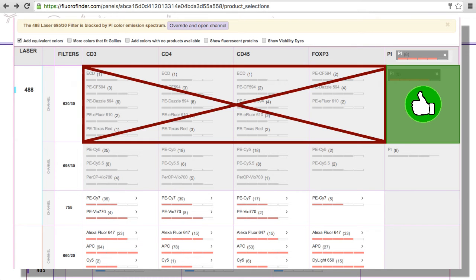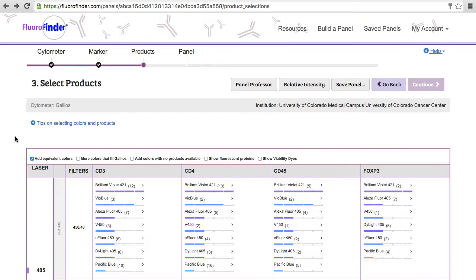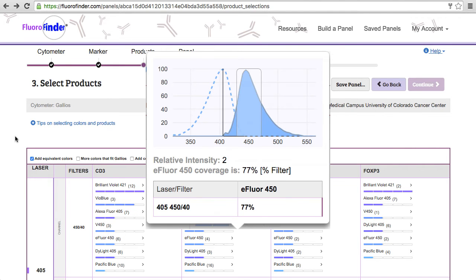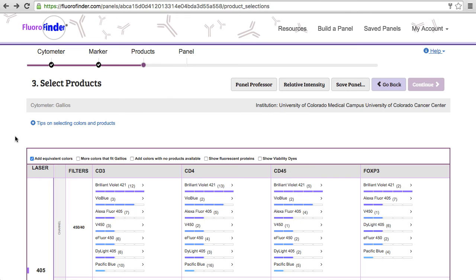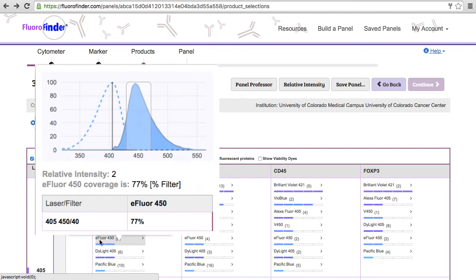It prevents selection of multiple products in the same detector, it blocks use of adjacent detectors with excessive spillover, and now it provides spillover pop-ups to guide your color selection. As an example, I will be taking a basic T-reg panel and choosing products based on the information that is provided in these pop-ups. In step 1 and 3 of the panel design utility, you can hover over a color to view its spillover pop-up.